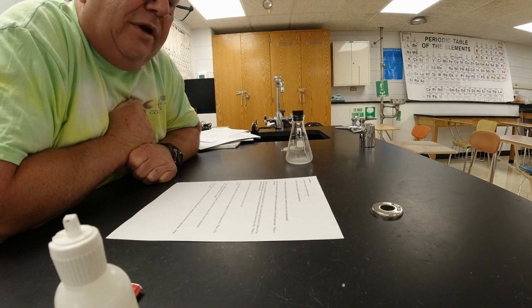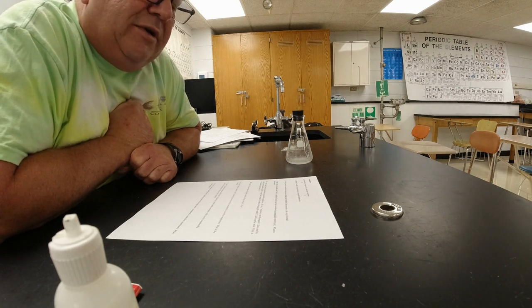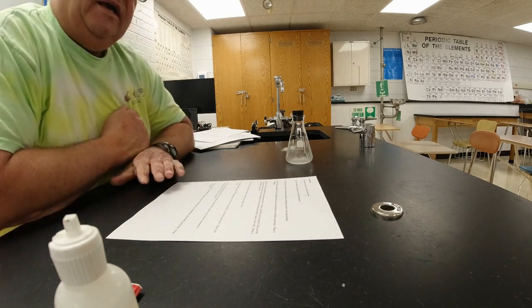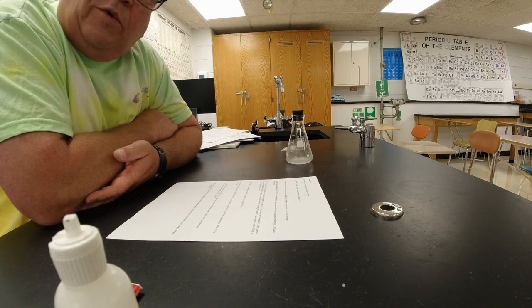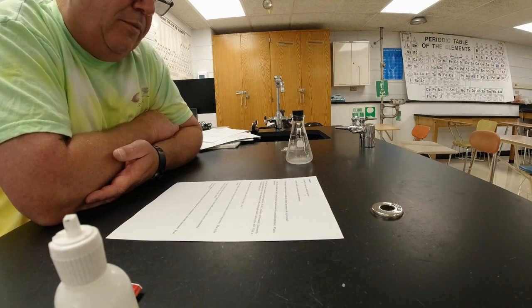In step number 3, if you remember, we were blowing out and we were lighting the gas that was above the wick. So in step number 2 and step number 3, what's the difference between what you did there? That's what the variable is. In number 5, 5B says, what happens if you wait too long? You actually saw me do that. If I waited too long, we couldn't relight the candle. So you should be able to explain why that happens now.